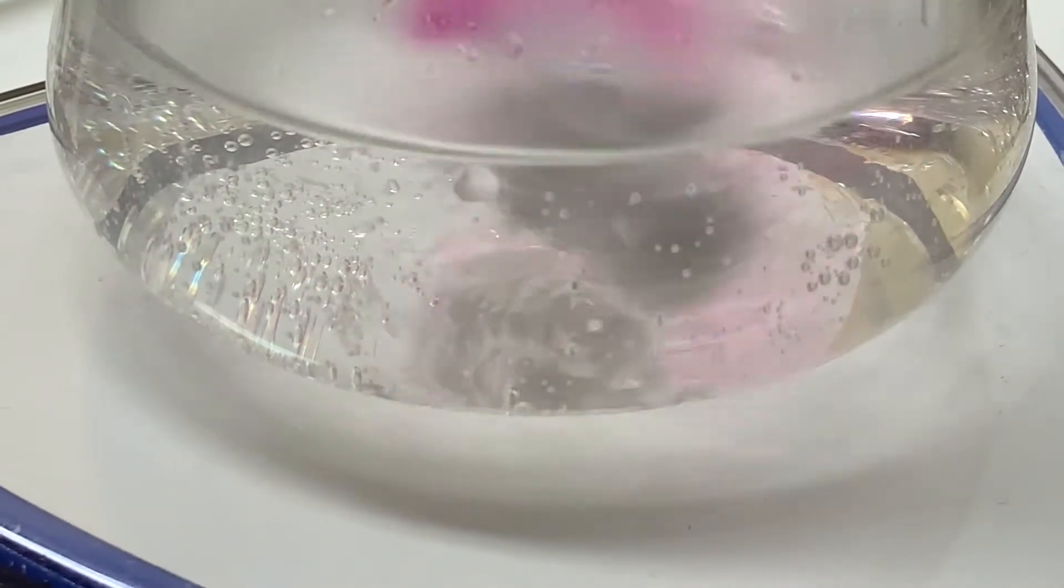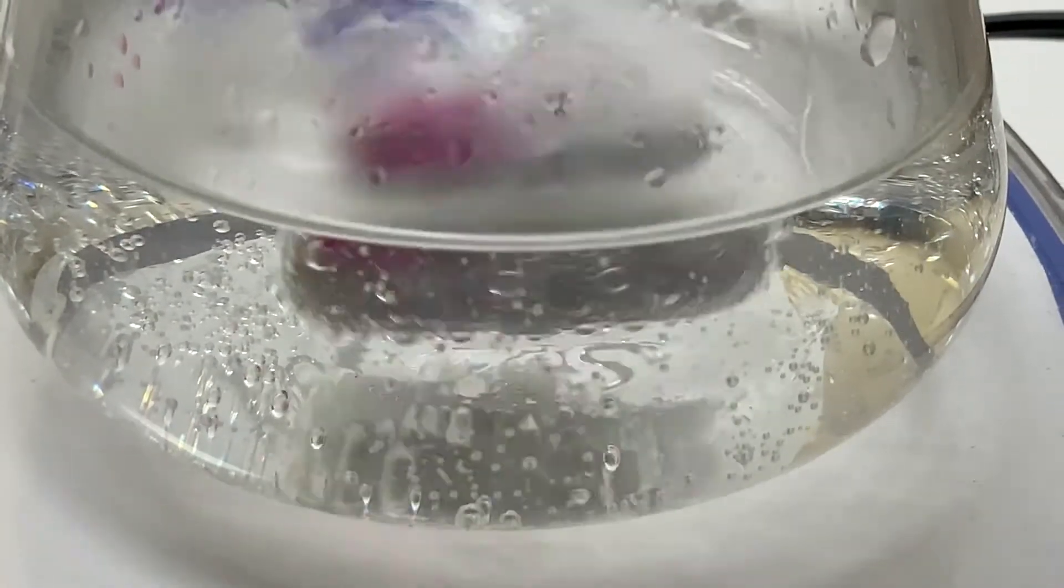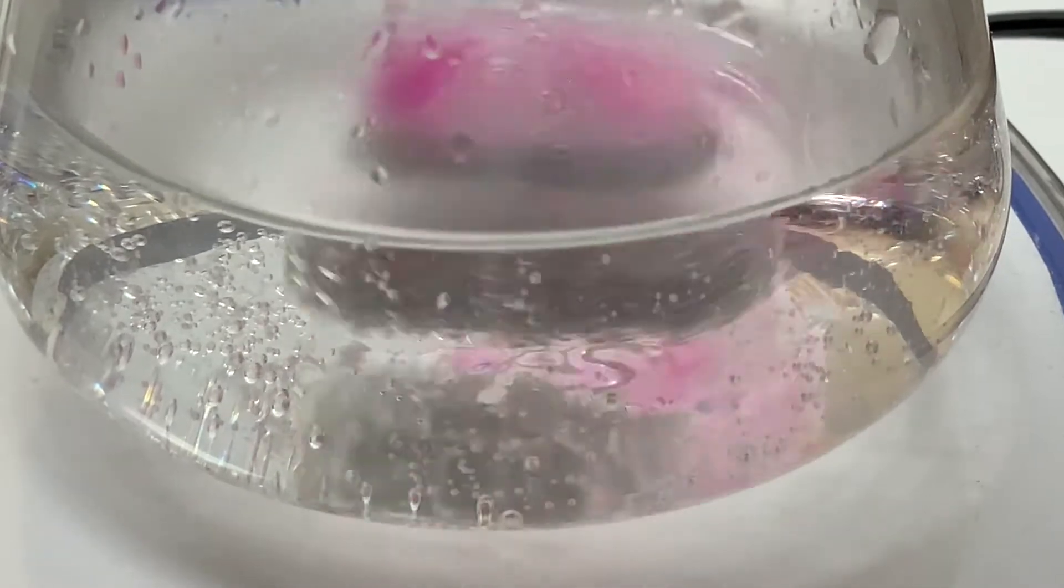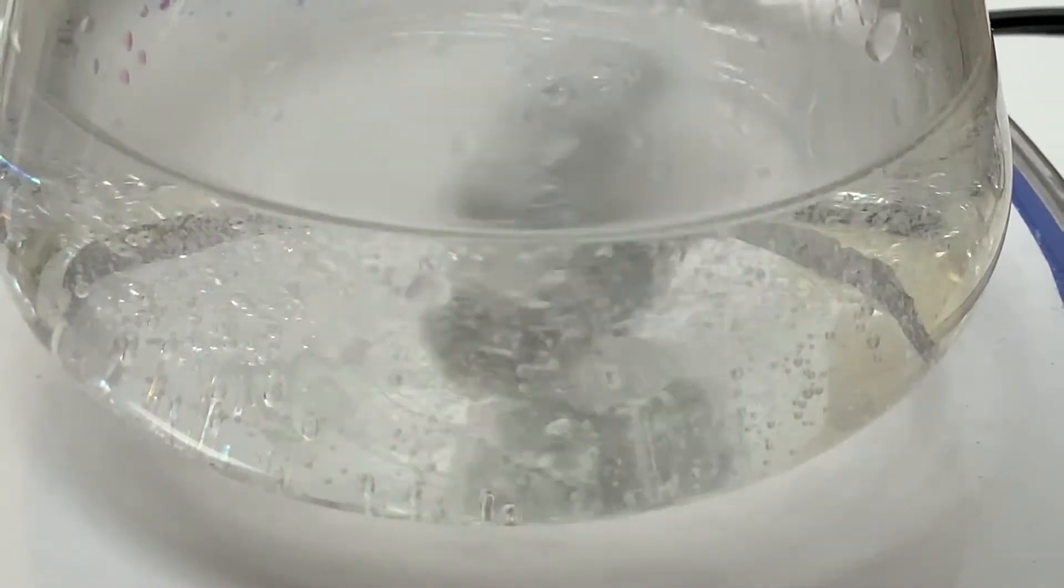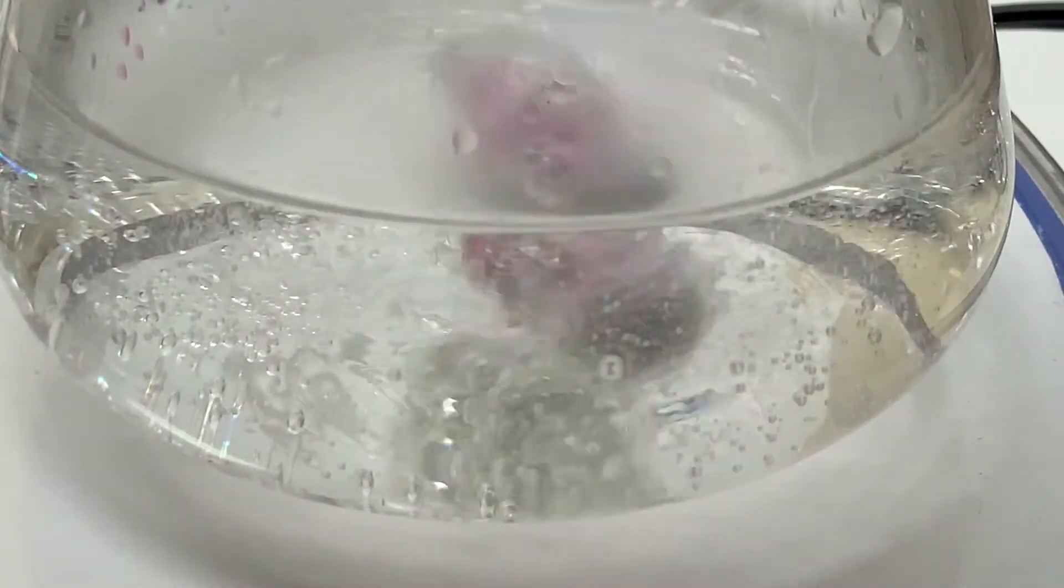Another look, you can see the pink started to persist. And when I slow the stir bar, you can take a closer look at the formation of the bubbles.